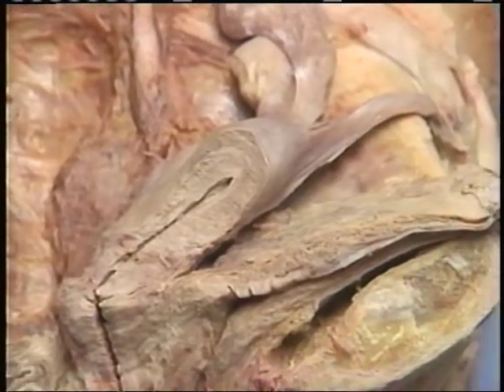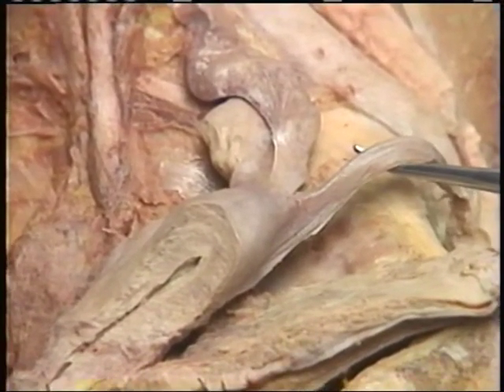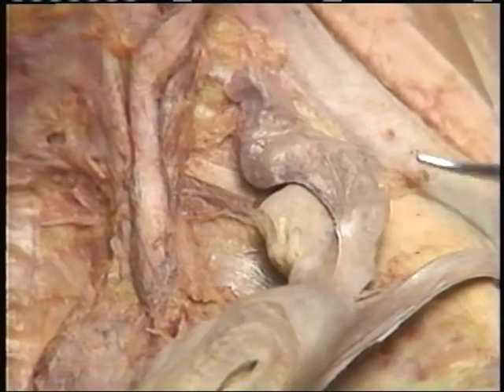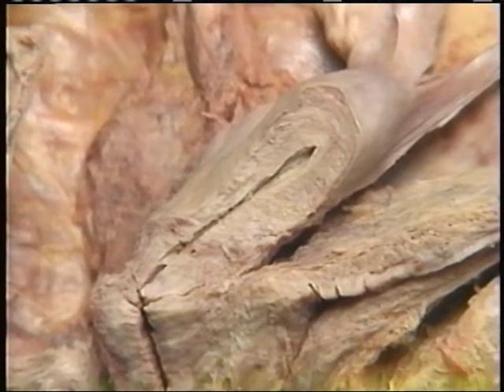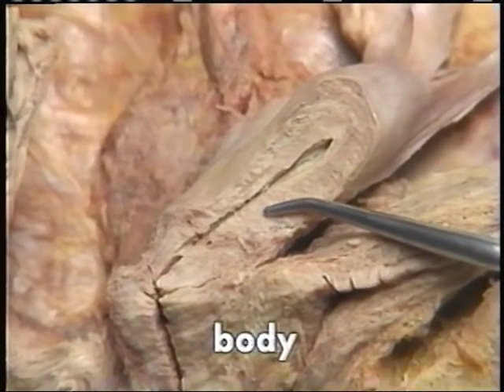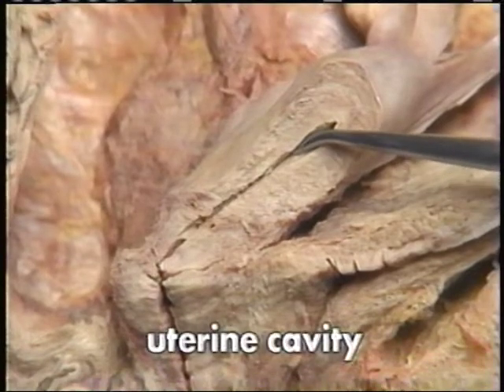Structures that we can identify include the round ligament, uterine tube, and ovary. The rounded region of the uterus above the opening of the uterine tubes is the fundus. The largest portion of the uterus is its body. The cavity within the uterus that is surrounded by its body is the uterine cavity.